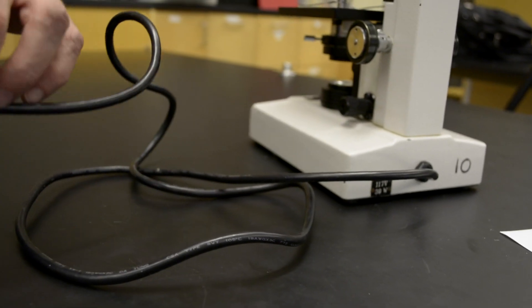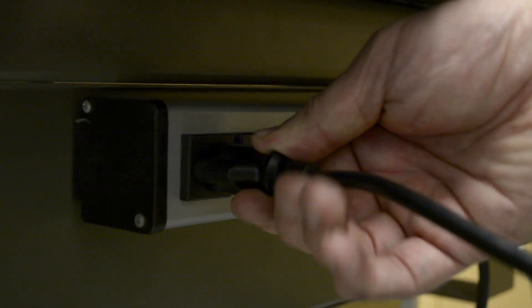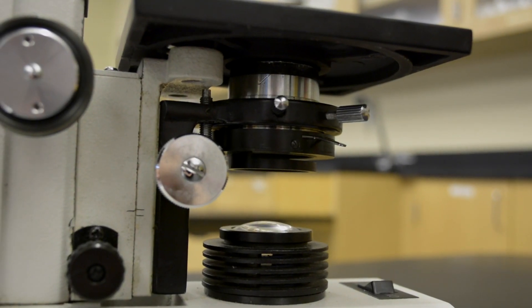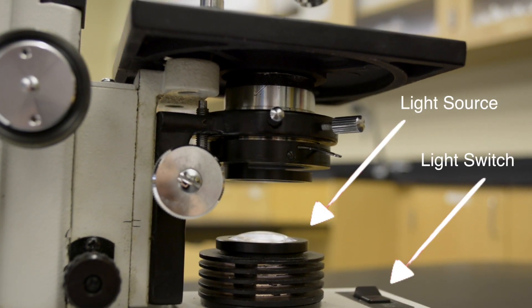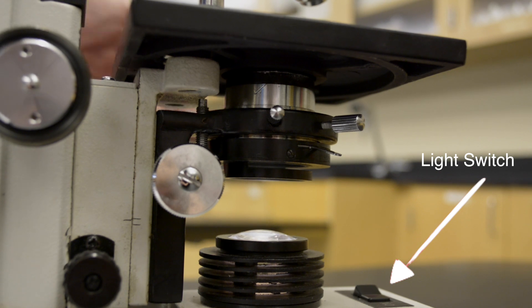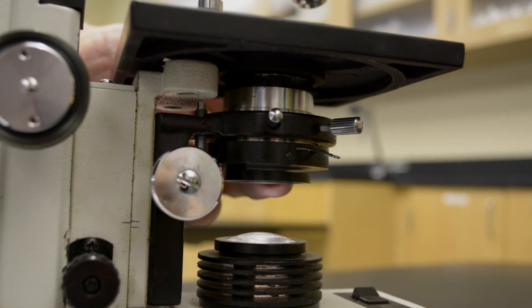Whenever you are ready to use the microscope, you first plug it in. The light you are going to use to look at the slide comes from the light source, which is turned on by the light switch, which can be found either at the front or back of the microscope base.